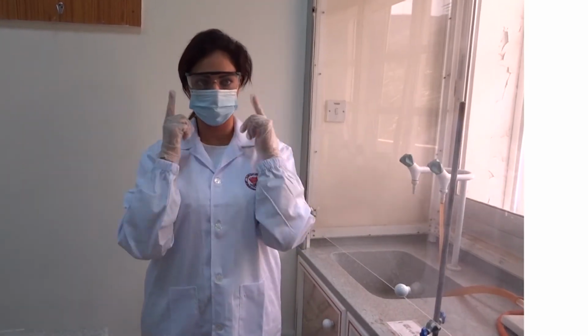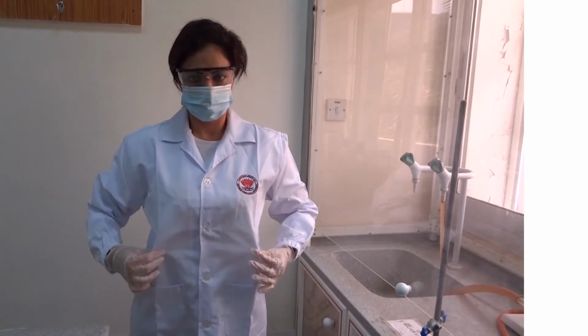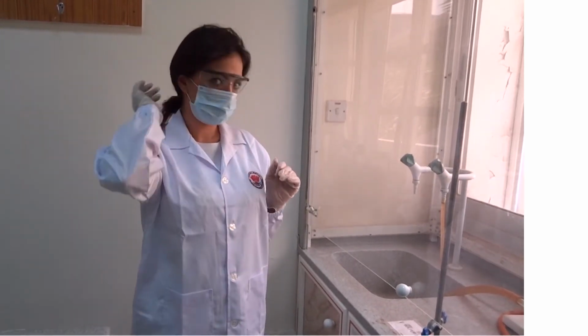Now you are ready to enter the lab. Let's discover the lab tools together.